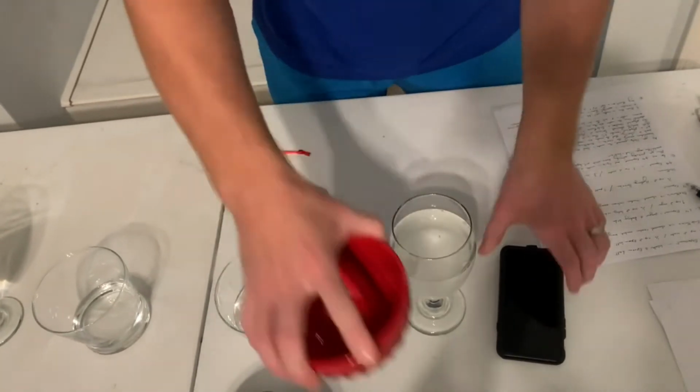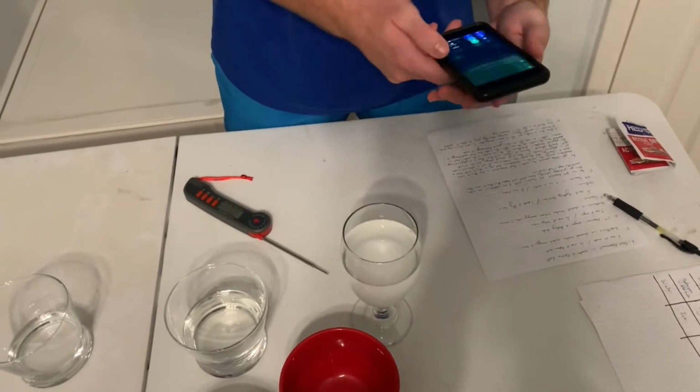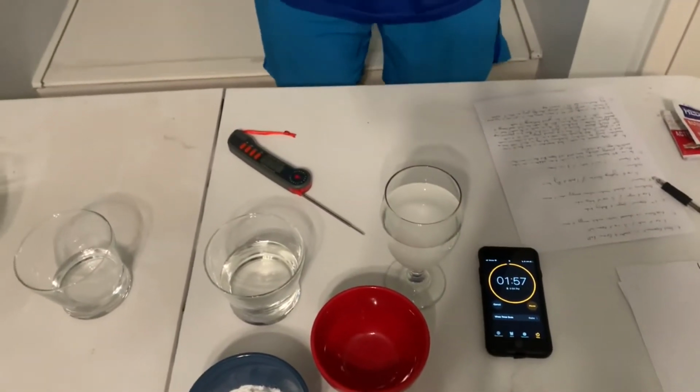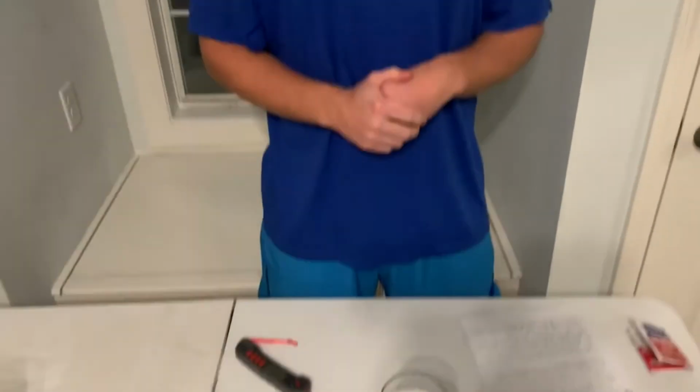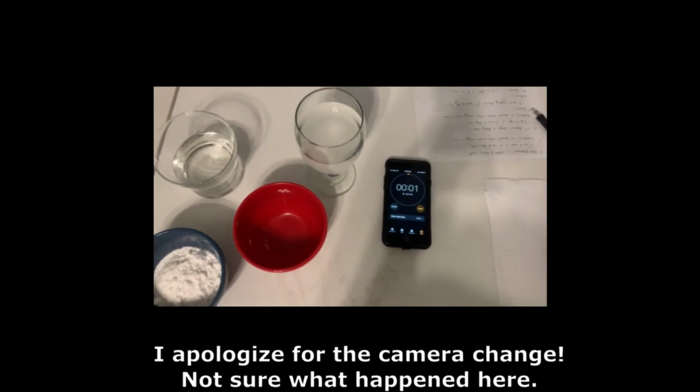Okay. And now I'm going to take my timer, set it for 2 minutes, and then we're going to wait for 2 minutes. Now, while we're waiting, the main question I have for you is, what do you think is going to happen? Do you think this reaction will be exothermic or endothermic? All right, now we wait. And there goes our timer.